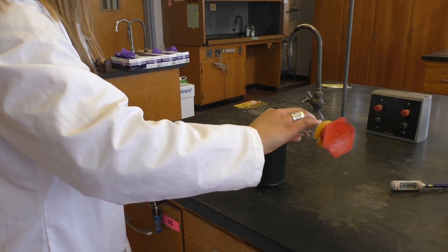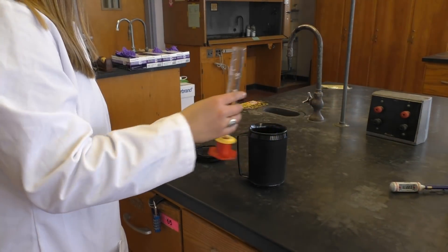So you first have to bring 50 mL of DI water to room temperature in your mug. This will take about 10 minutes.